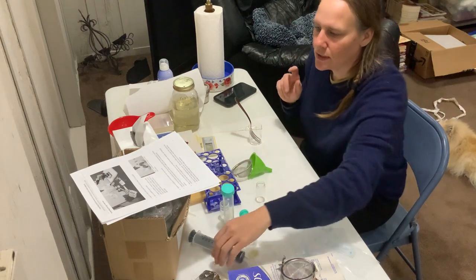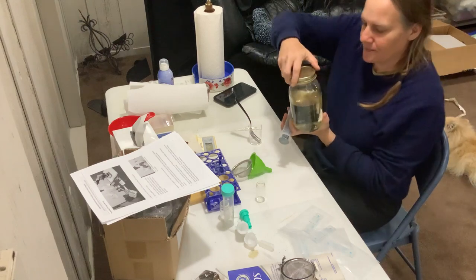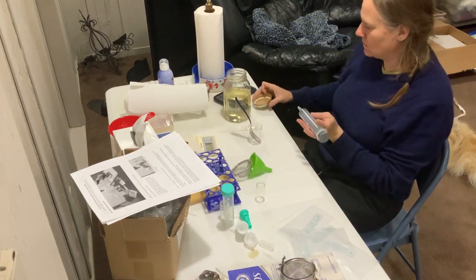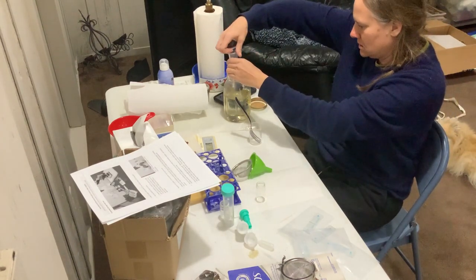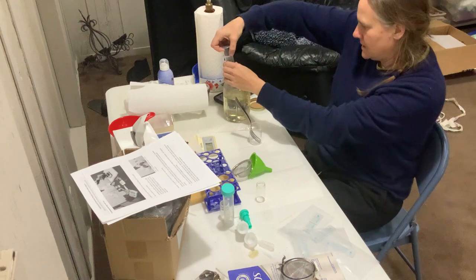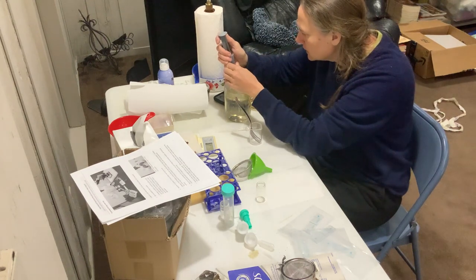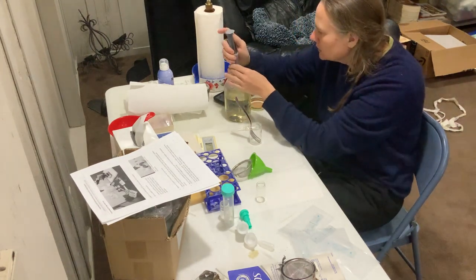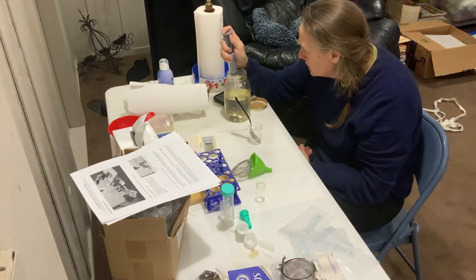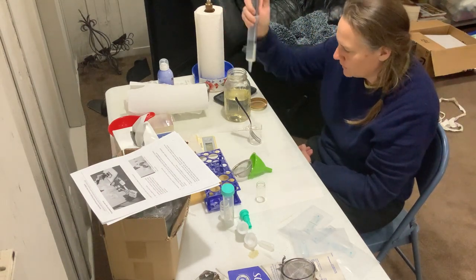I don't want any bubbles in there, so I've cleared the tube and I'm going to suck up 28 ml. It's got a little bit of an air pocket there — 28. Alright, and then I put that into the beaker.